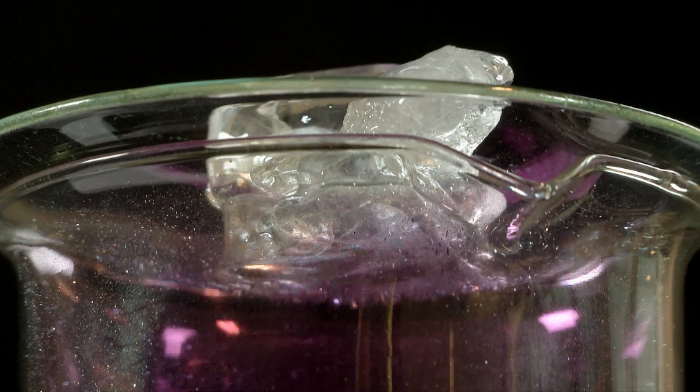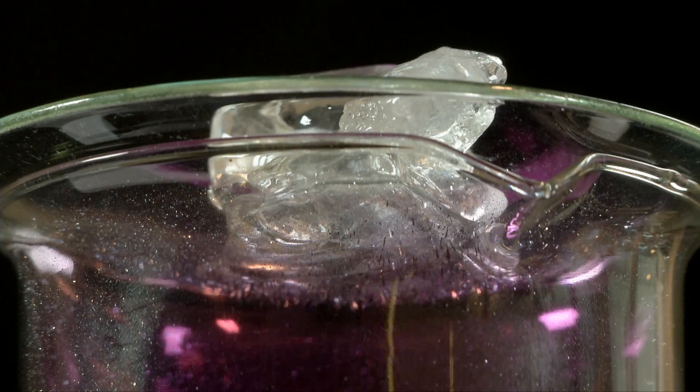Crystals then form on the bottom of the watch glass as the iodine crosses back over the sublimation line into its solid phase. This is deposition.